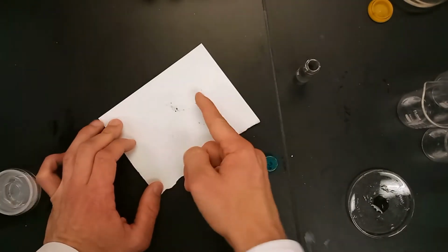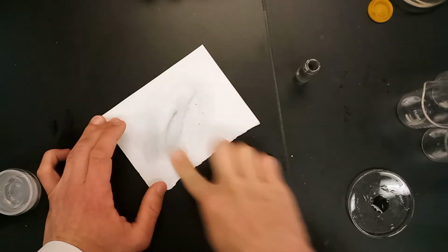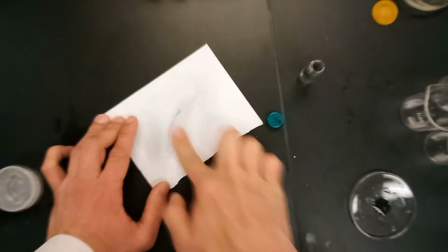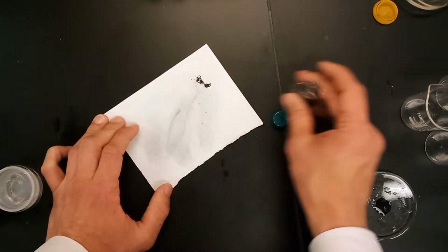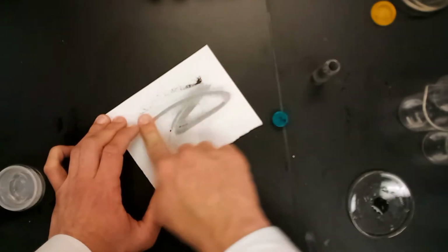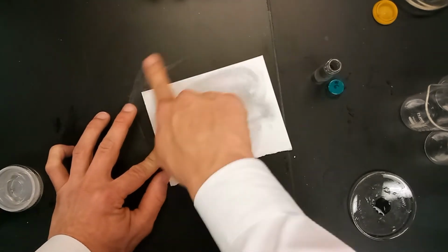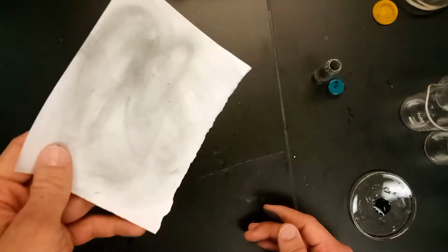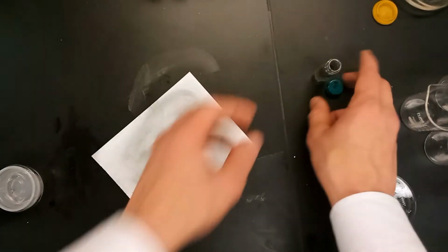So we're going to drag our finger across, just like we did with the other one. You're probably familiar with how this one writes, actually. Maybe take just a little bit more. Oop, that was a little much, but it's okay. So again, you could drag it across the piece of paper. And you'll notice this one does write. When you shake it off, it doesn't come off the paper. So that's the one thing you could tell from this one, which is number 6.